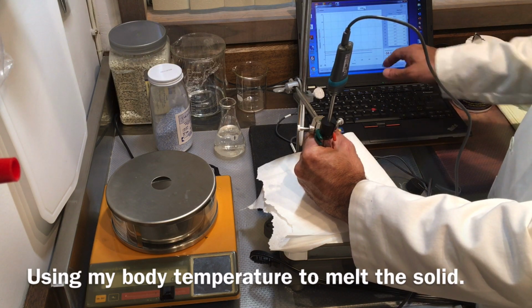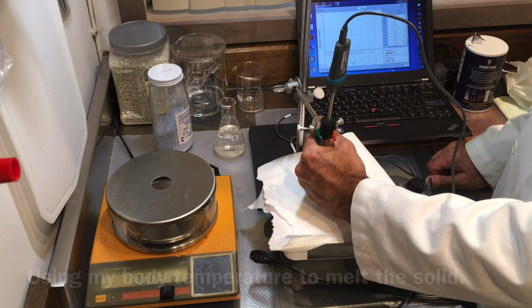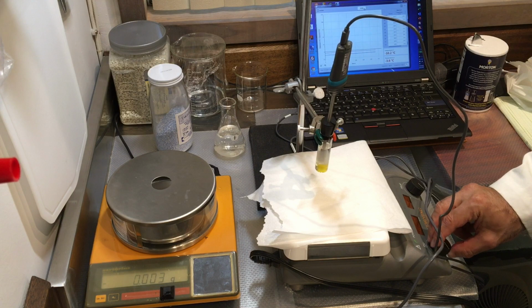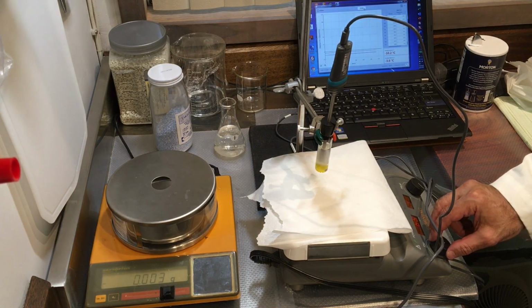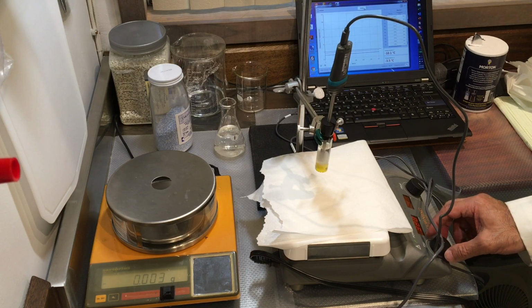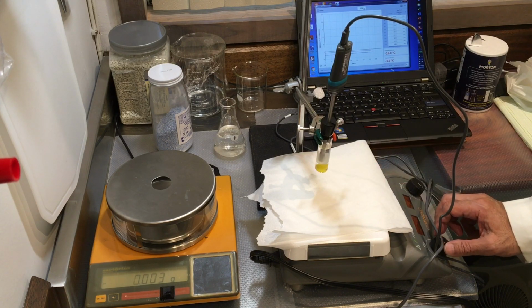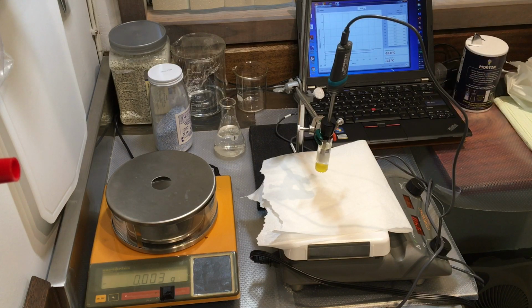So you see the temperature is -3.7. You see the stirrer is starting to want to move. So there it is. Okay, so now you are watching the melting process. We are collecting the data, and we're going to be looking at melting anyway. You can see that there is ice floating, the mixture is turning, the temperature is rising.